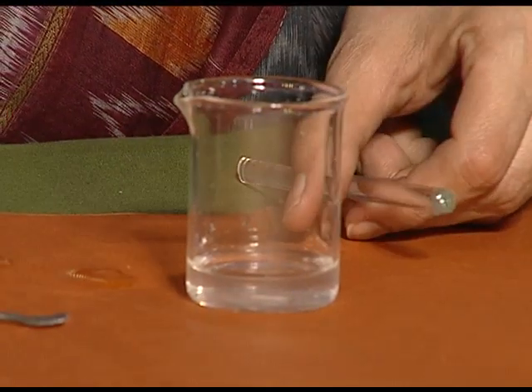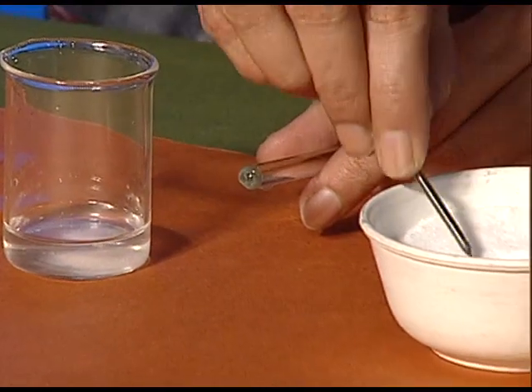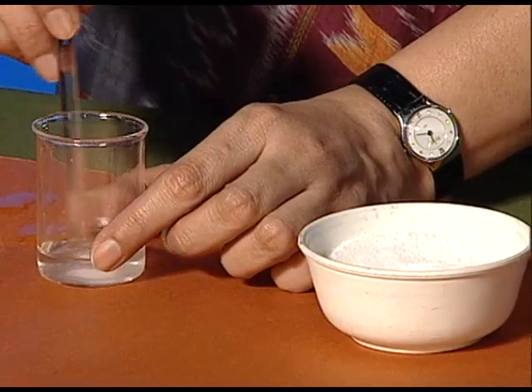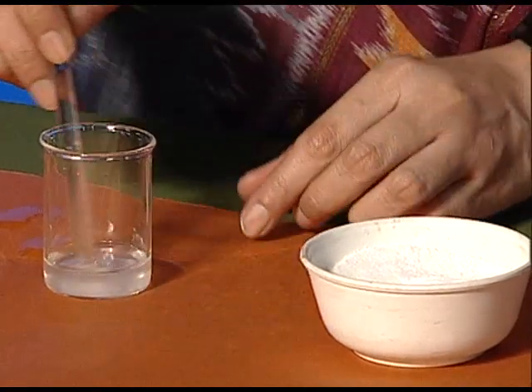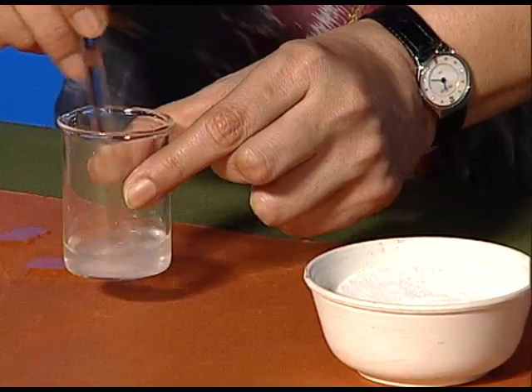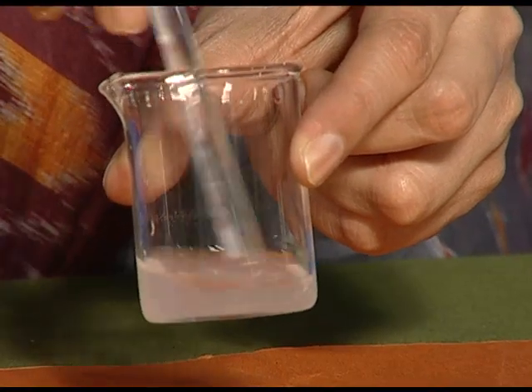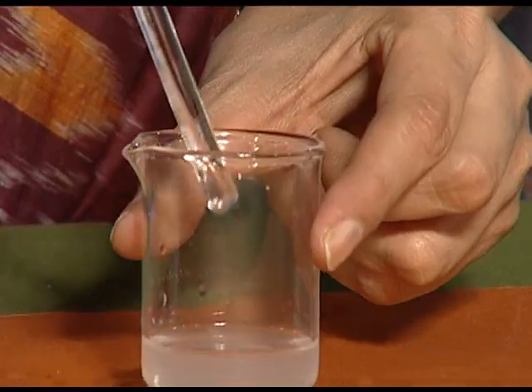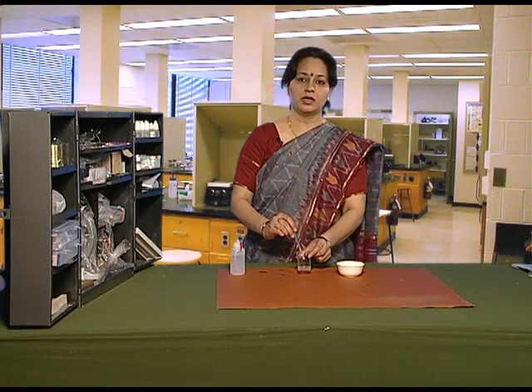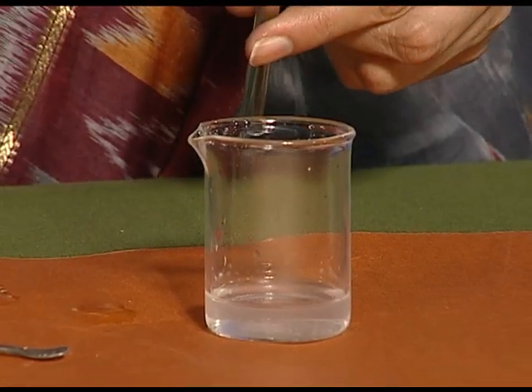In this way, go on adding more spatulas of salt with constant stirring till the salt completely disappears. Again, you can see that it has formed a clear solution and we can no longer see the salt.